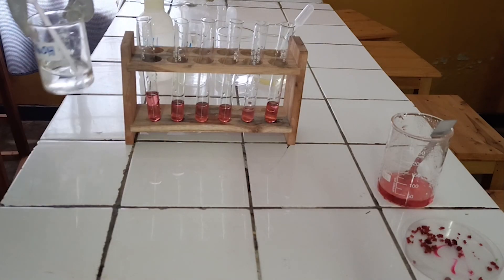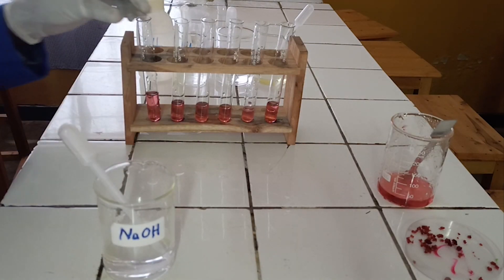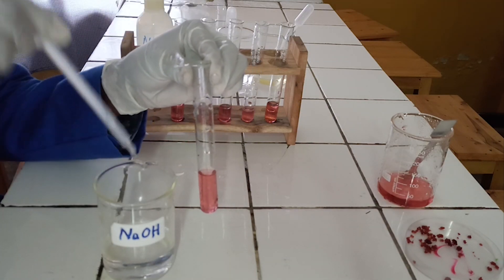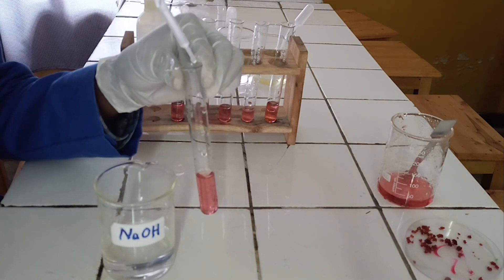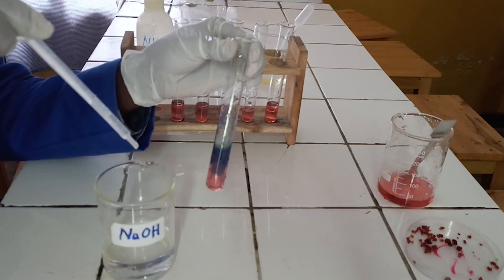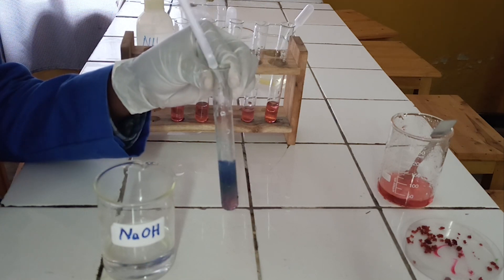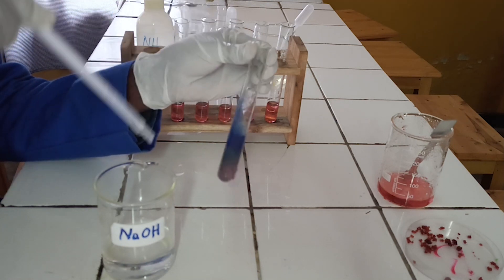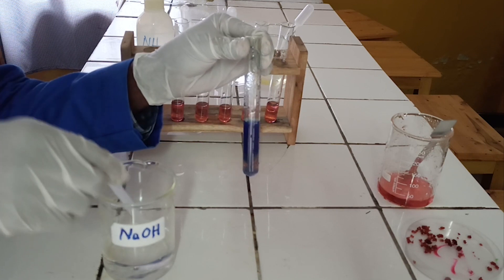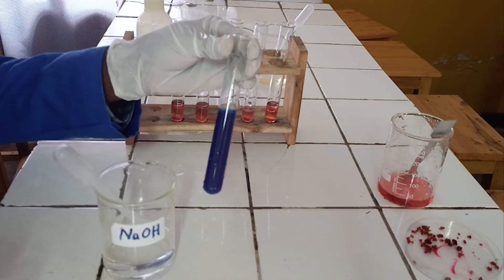Preliminary tests. To the first test tube, add sodium hydroxide solution dropwise until in excess. As you see, sodium hydroxide reacts with cobalt-2 ion to form a blue precipitate, which is insoluble in excess of sodium hydroxide.